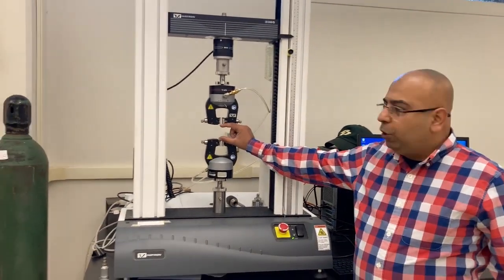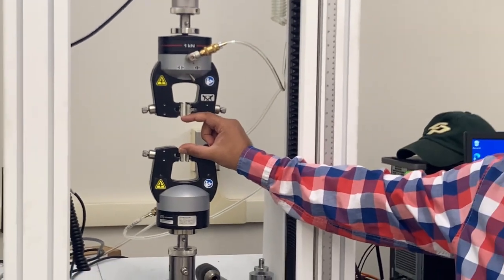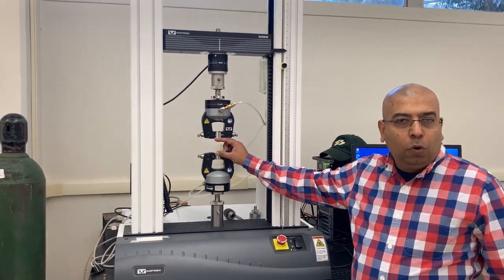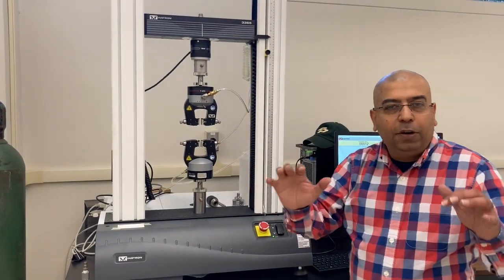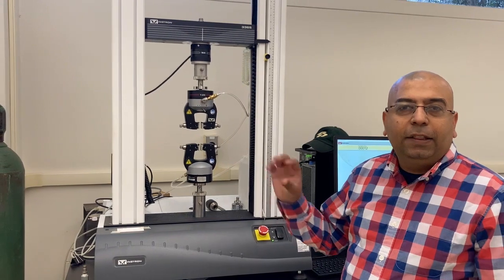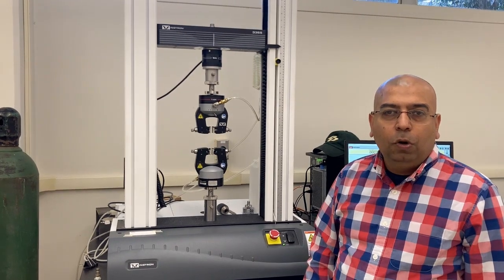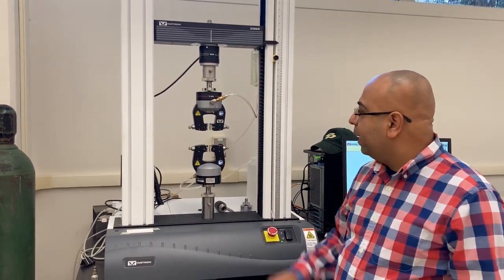So the distance between the two grippers right here, this is also known as grip separation. So that is the length of the film that you are stretching. And when I was explaining on the board, L, so that is the L. So it could be set at a particular number of interest. So those numbers are dictated by standard, ASTM standard. So for testing thin plastic films, we have an ASTM standard called ASTM D882. A copy of that is also available on our Cal Poly's library website, so you can download that.